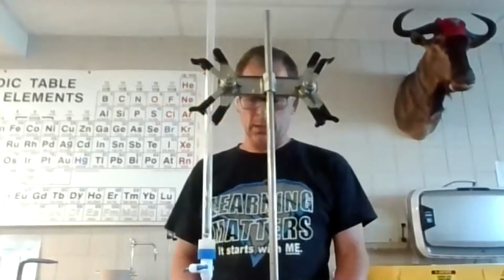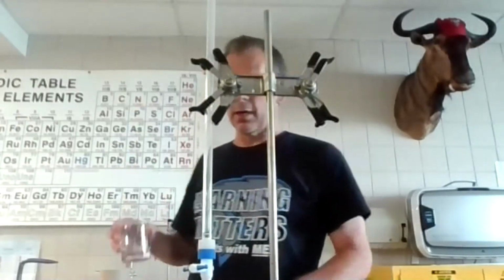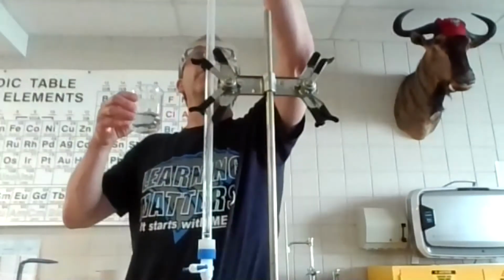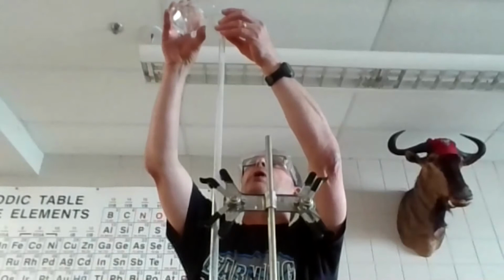Okay. So the next thing I'm going to do is I'm going to take, let's see. So I got my base. Oh, I got to put some stuff in the burette. So I know this is my base right here. And what I'm going to do is I'll probably use a funnel this time. And I'm going to go up and pour this in. I want to make sure the valve is closed down there. And I'm going to add that.